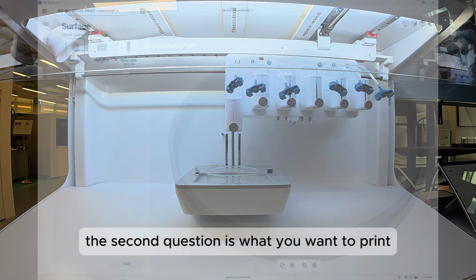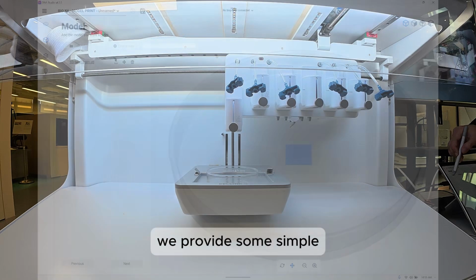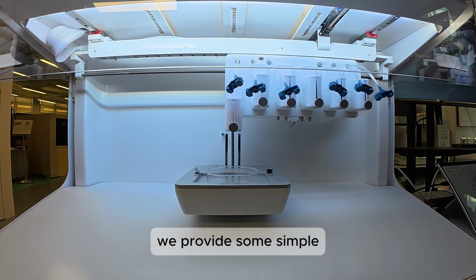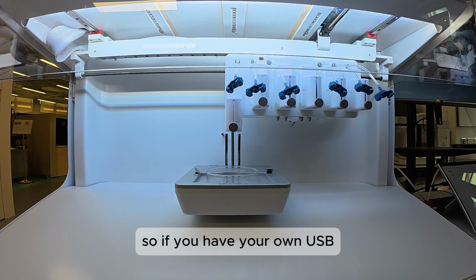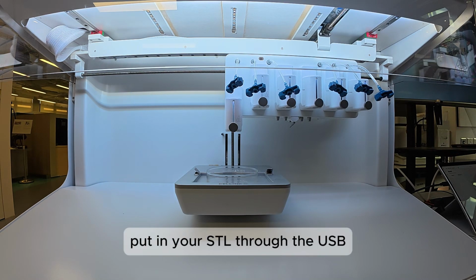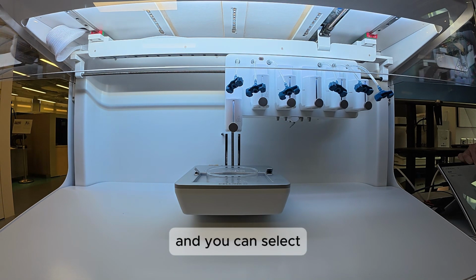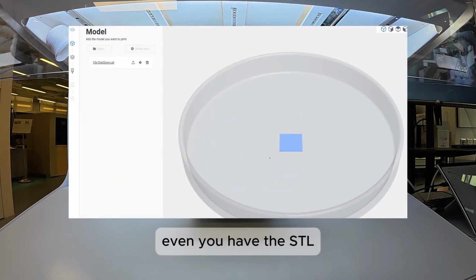The second question is what you want to print, so you have to input the 3D model. We provide some simple STL files in the USB that comes with it. If you have your own USB, you can also put in your own STL through the USB and select it, and it will showcase your model over here where it will print.